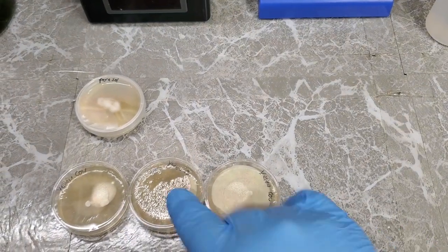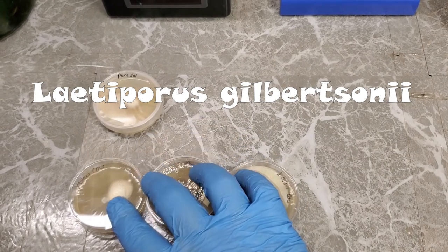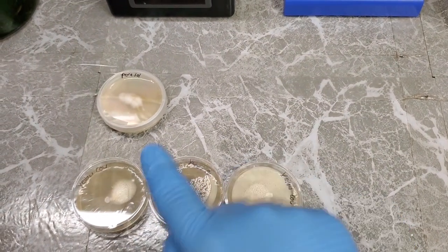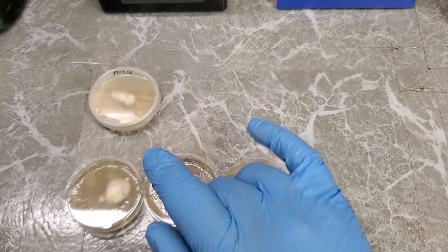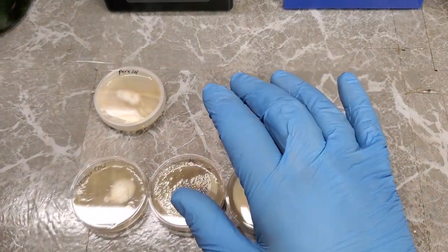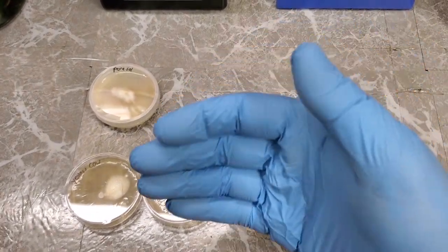Down here, I have three culture samples of a wild yellow-pored chicken of the woods mushroom that I cloned onto agar, well, I attempted to clone onto agar. These are only three of like 15 samples that I took from that nice little fruit body that I found growing on a dead, I think it was an elm tree.